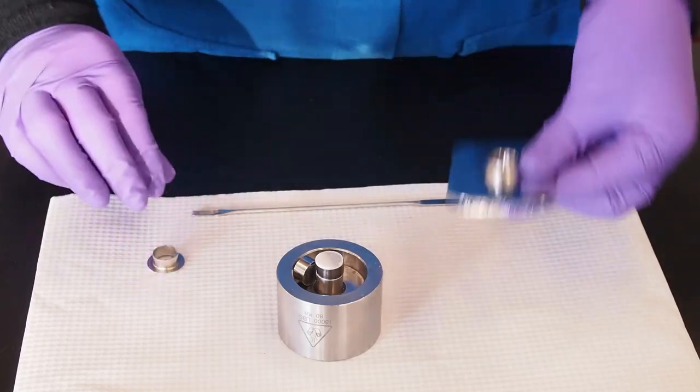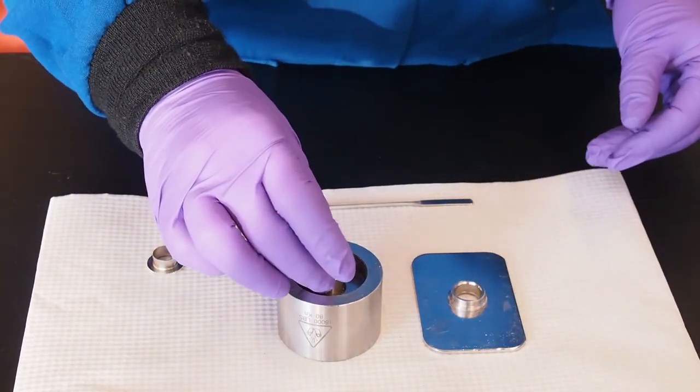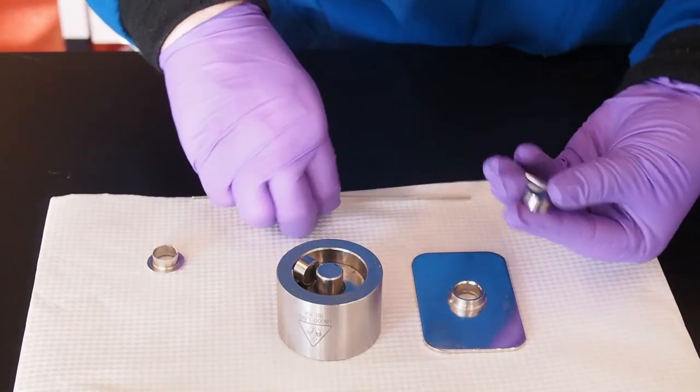Open the pellet holder and carefully place the pellet inside using the spatula to help with proper positioning.